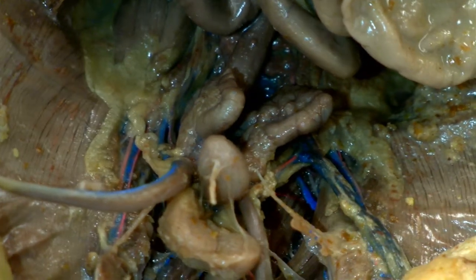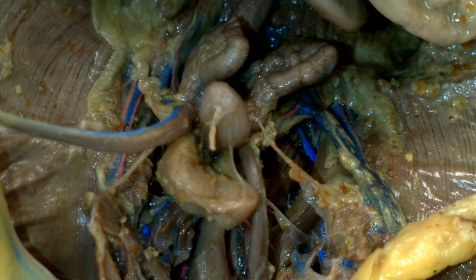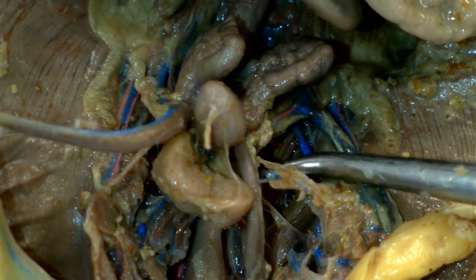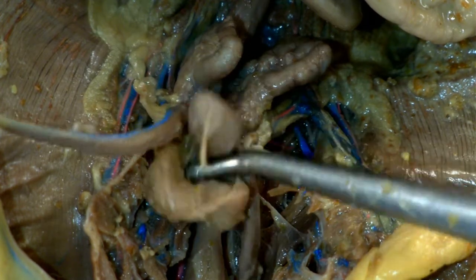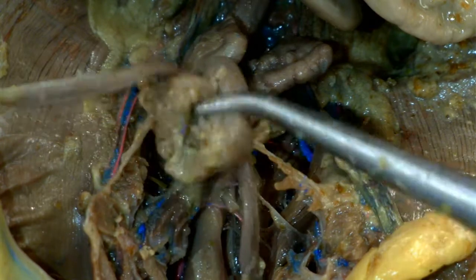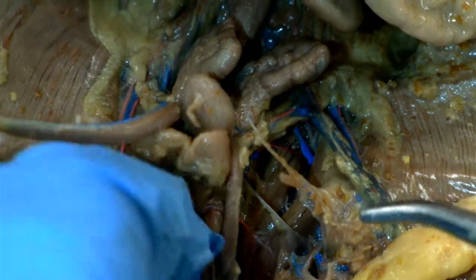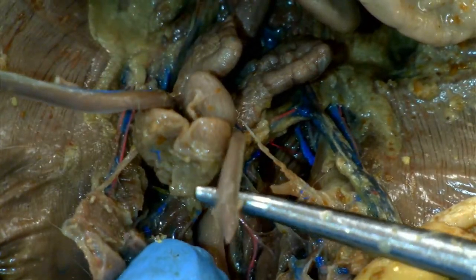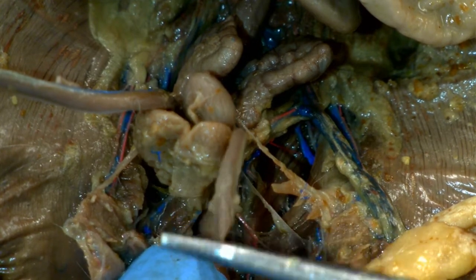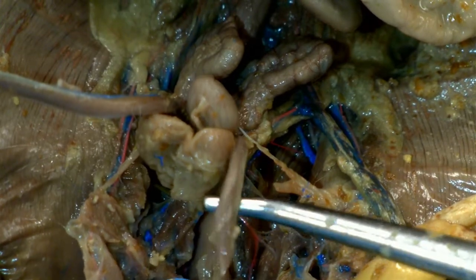So all of these glands produce material that has to leave the body in order to fertilize the female, and of course that has to occur via the penis. The penis was attached here — you can see this was the penis, and I cut it when I was dissecting the body wall of this animal.